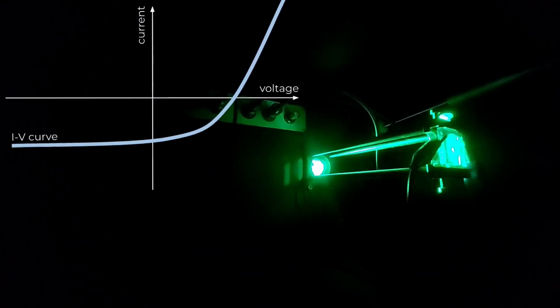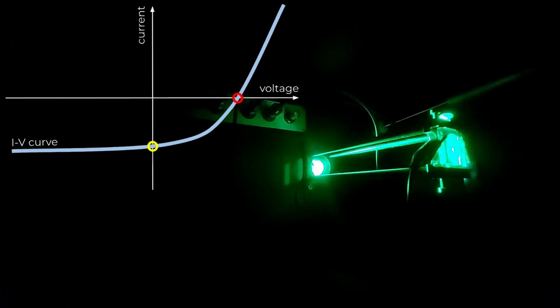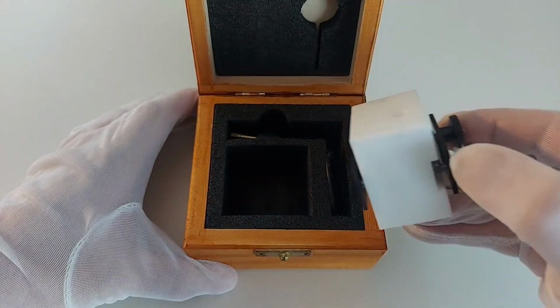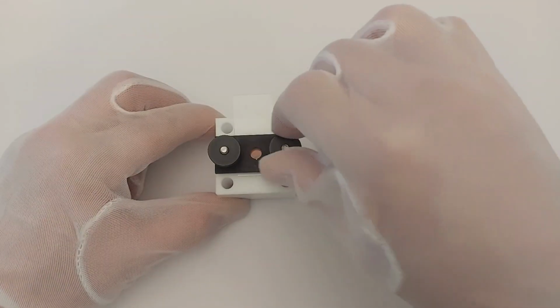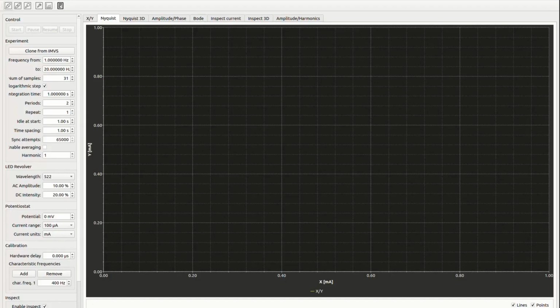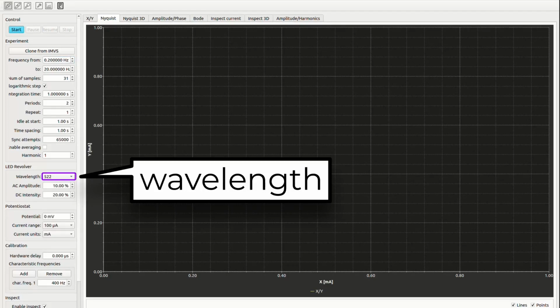How? These two related experiments rely on measurements of short-circuit current and open-circuit potential, respectively, when the sample is excited by a modulated light. In order to do that, just place the sample in an electrochemical cell or any other holder in the sample chamber. Connect the electrodes. Define the experiment parameters such as frequency range, wavelength, and light intensity.